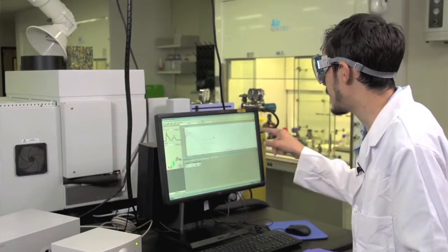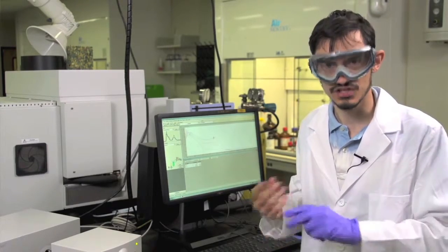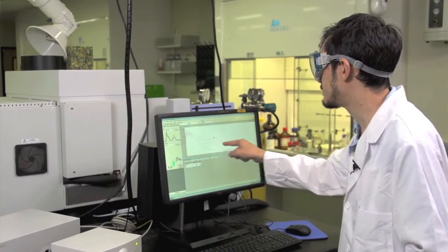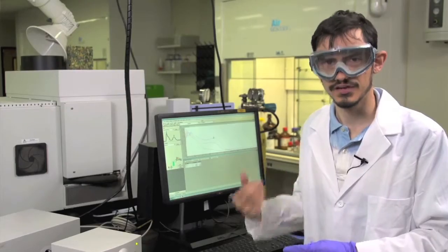Make sure that you export all of your spectra as CSV files to your H drive, and also that you save the individual spectral files to the public folder on the computer.